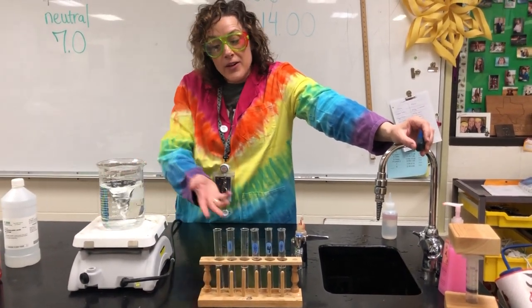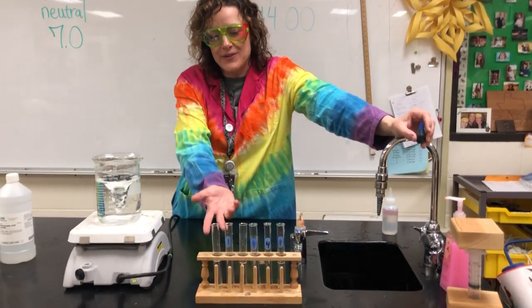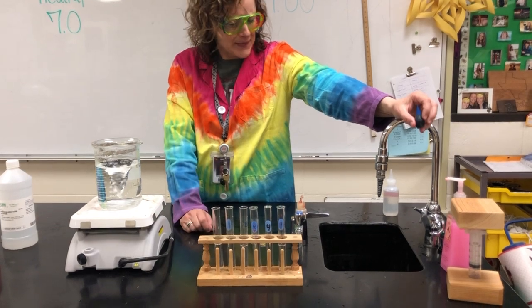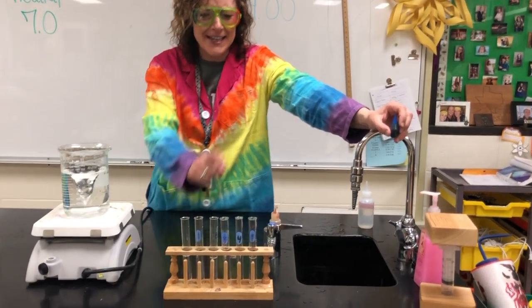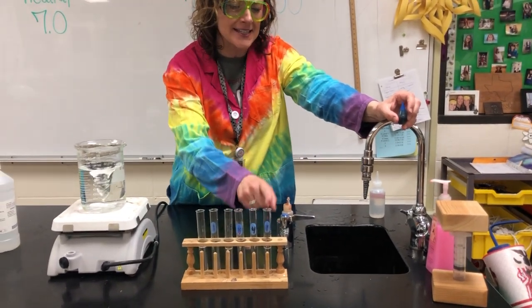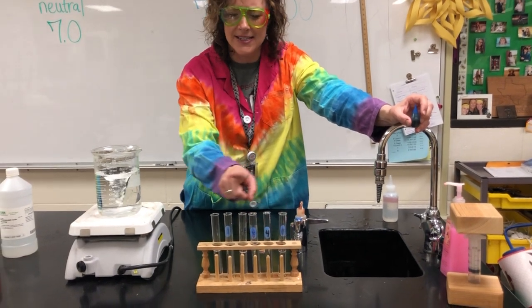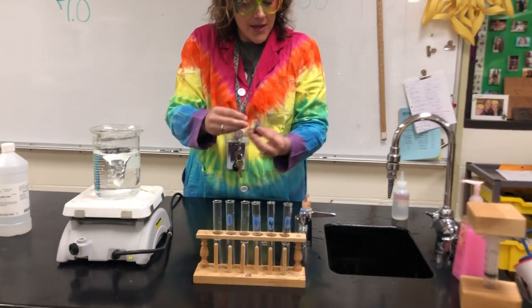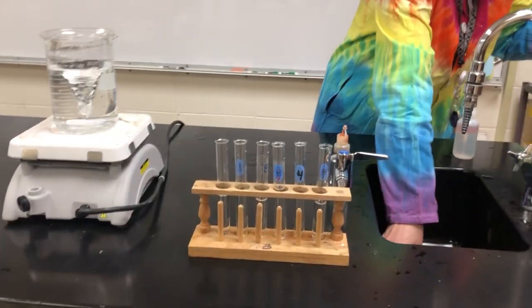So before we did that, we were getting this ready, and we don't remember which side is which. So we think that this is the most concentrated, like the scary, strong hydrochloric acid, and we think that this is the least, but it really doesn't matter because I'm going to attempt to drop just 1 drop of plain old food coloring.